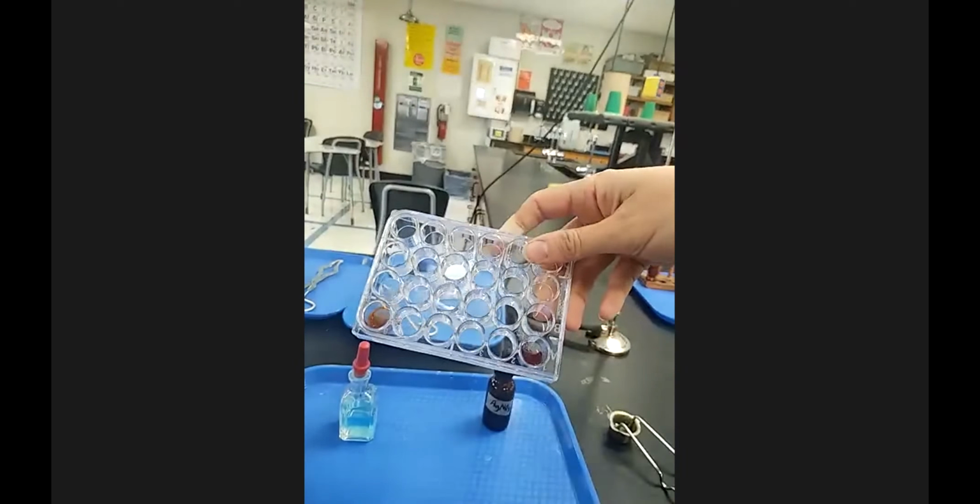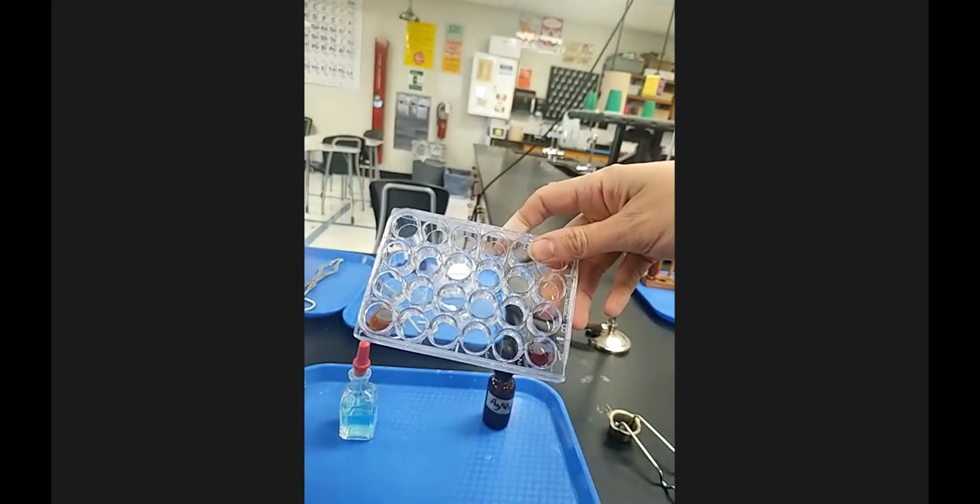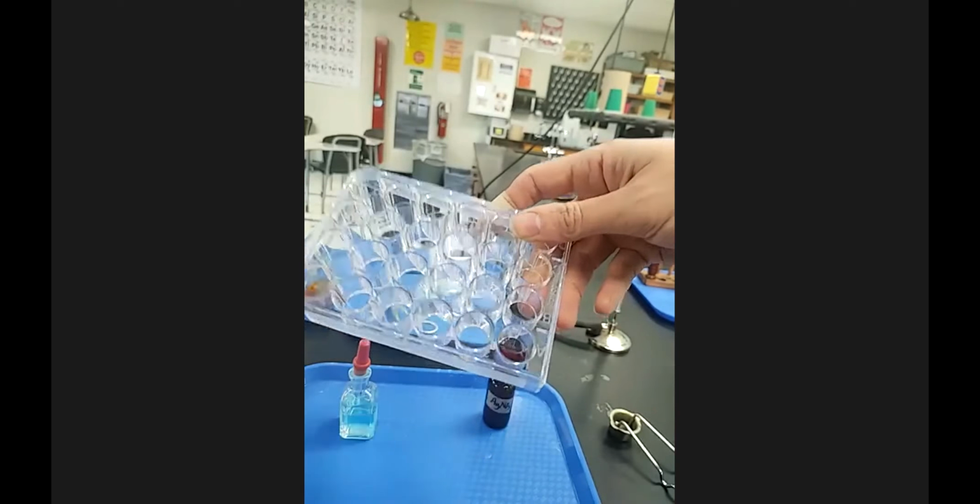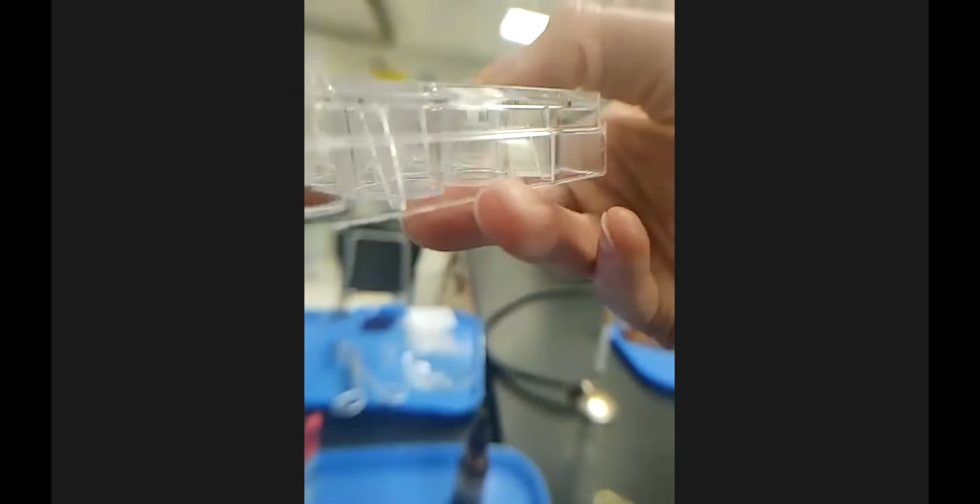I show both of these. This is definitely an oranger, orangier. This is a really dark brown red here. And that's a side view. I'll try and tilt it up for you guys to get the top view of it, or I guess from the bottom up.